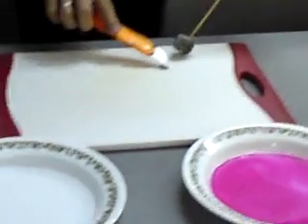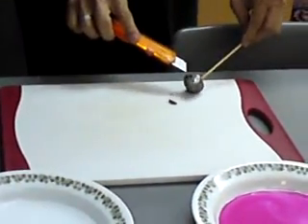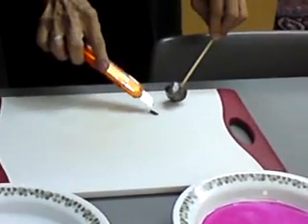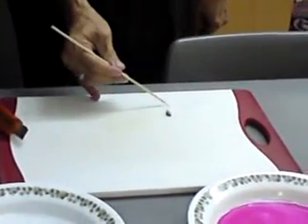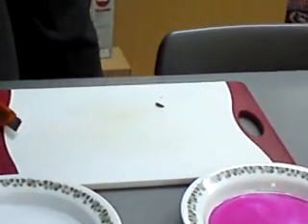The place where you cut it is shiny, but after that it dulls very quickly with the formation of potassium oxide with oxygen in the air, because the potassium will be reactive. Now this piece is quite big, let's cut it into a slightly smaller piece.